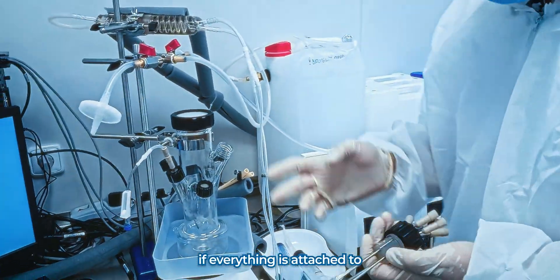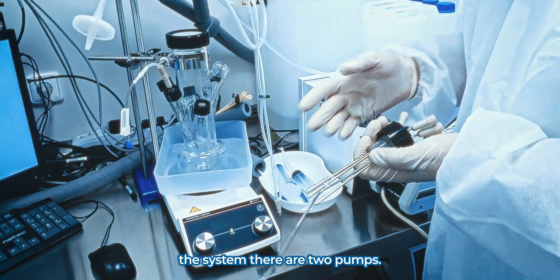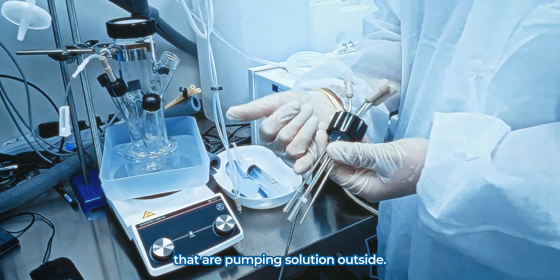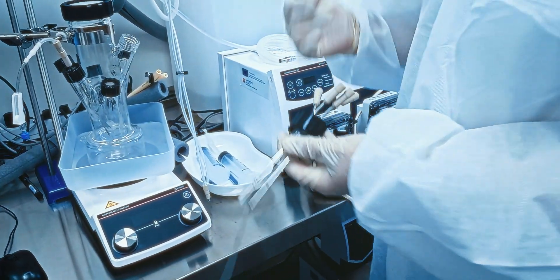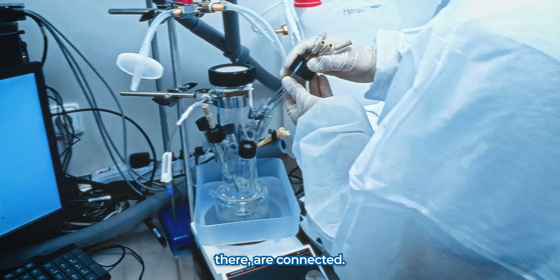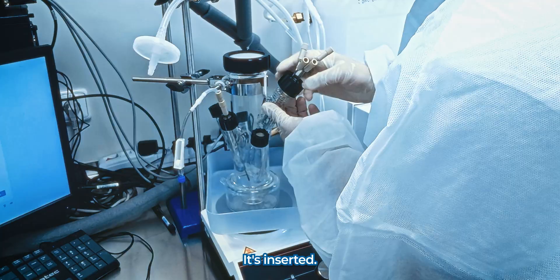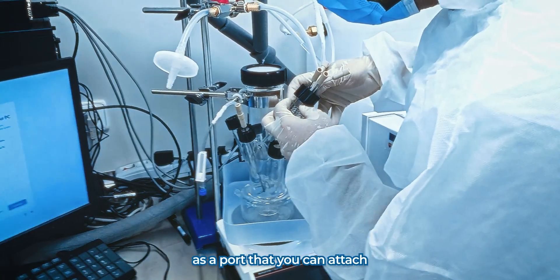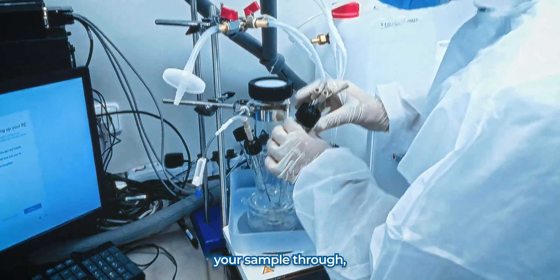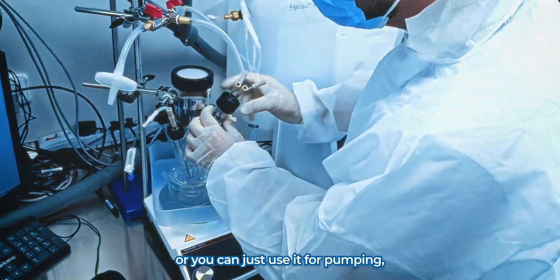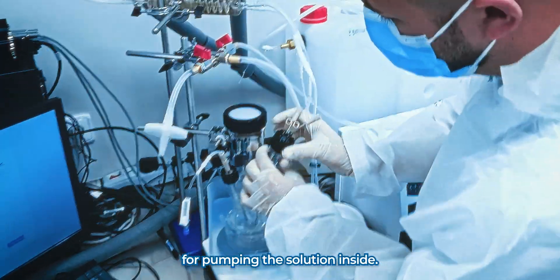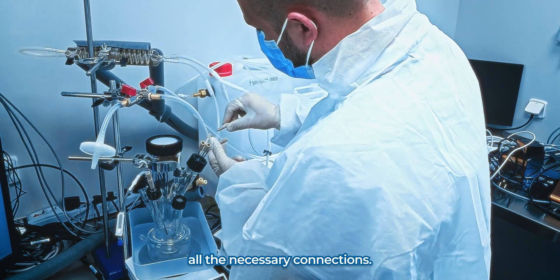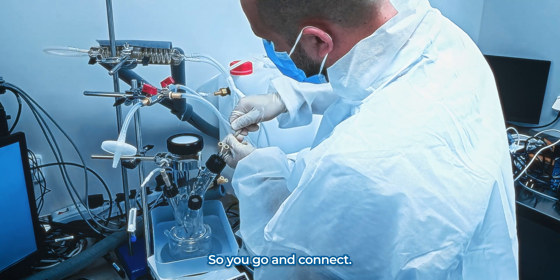So what do you do with the decellularization? If everything is attached to the system, there are two pumps, but there are two ways that are pumping solution inside and two ports that are pumping solution outside. The solution and the samples, they are connected, it's inserted. So this port either can serve as a port that you can attach your sample through, or you can just use it for pumping the solutions inside. Then you can connect all the necessary connections. So you go and connect.